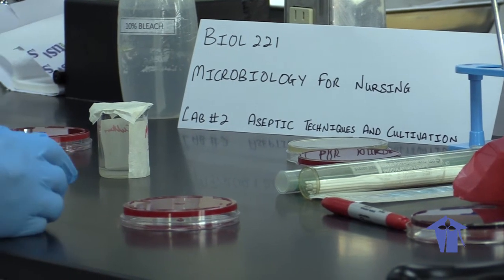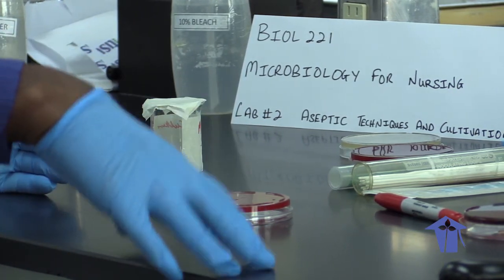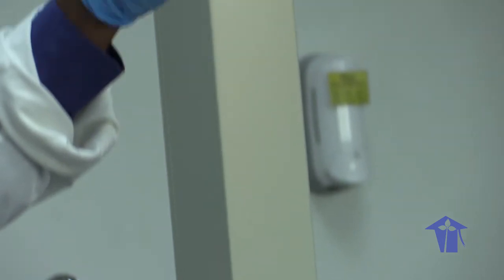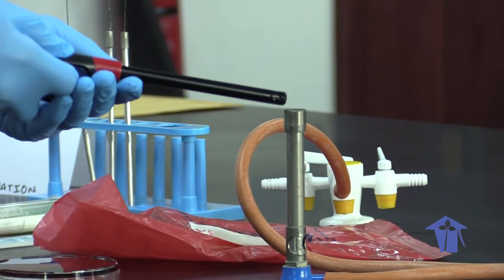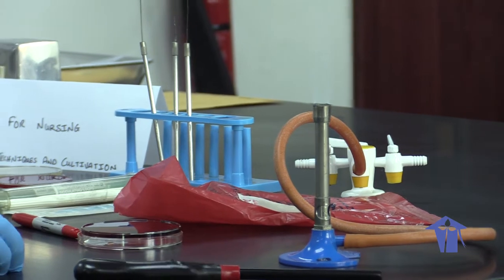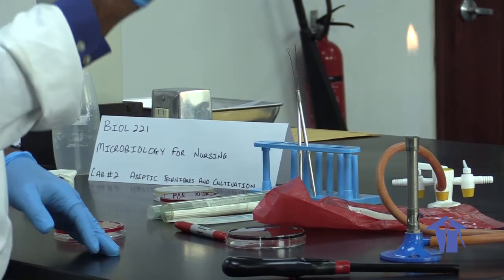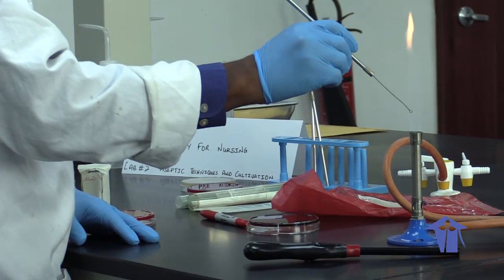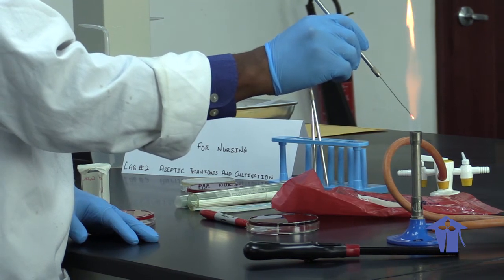Last but not least, we're going to demonstrate the quadrant streak technique, which isolates individual colonies out of a mixed culture. Here we have a mixed culture in our broth — the liquid medium — and you can see that it's slightly cloudy. We're going to employ a technique known as flaming. I'm turning on the Bunsen burner — it burns with a blue flame. Make sure it has a yellow tip so you can see it visibly. This is how we sterilize our wire loop — we know the loop is sterilized when it becomes red hot.